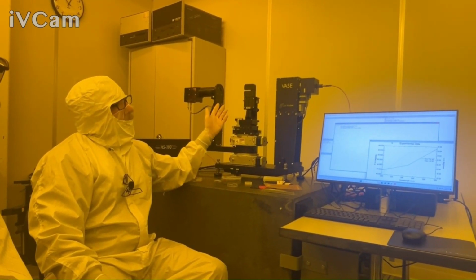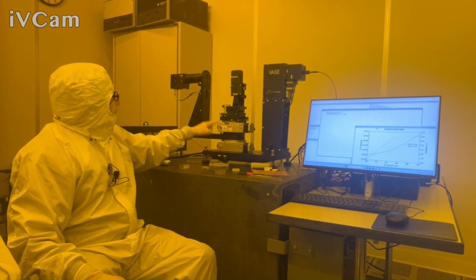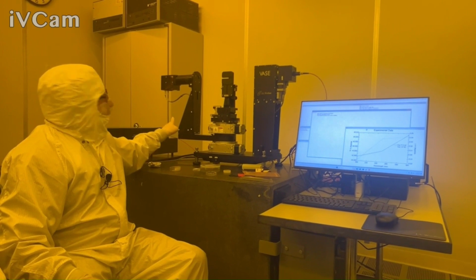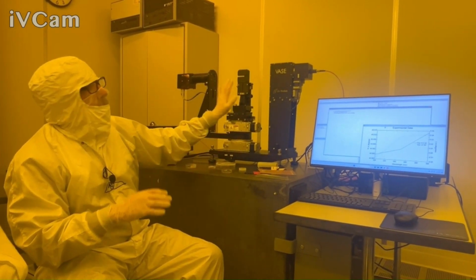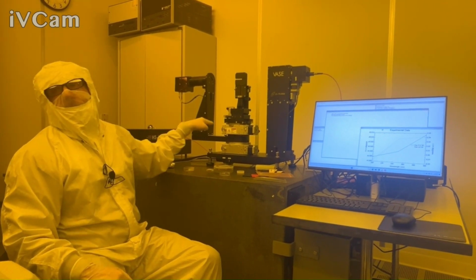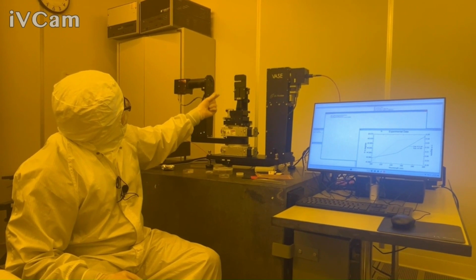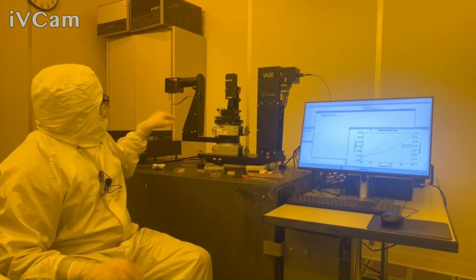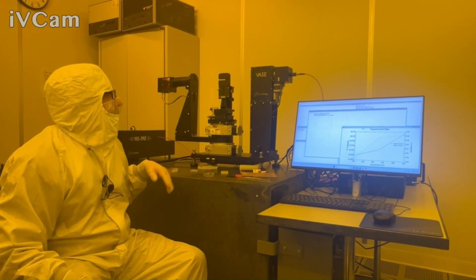The other way to trick it is just to say do 90. That way it goes 90, 180. But I'm just following what the manual said. So if I do it this way, I've just got to make sure the stage is out of the way. If that's at 0, I'll go through the middle. If it's at 90, most of the beam misses because of the slot, but I don't want to risk it. So I just get it out of the way.